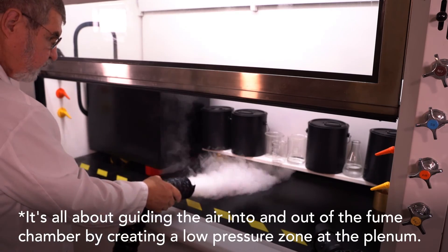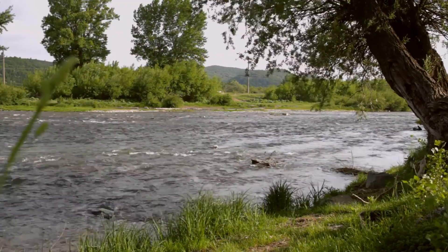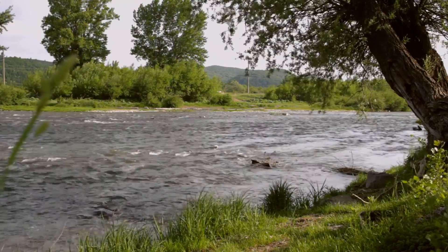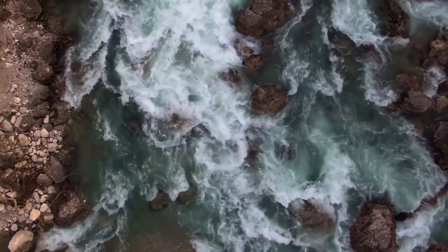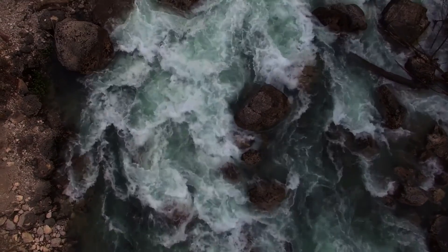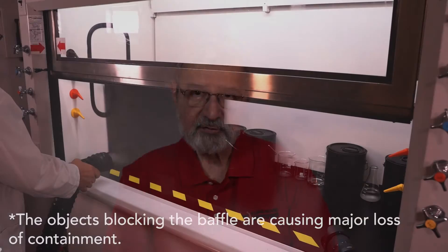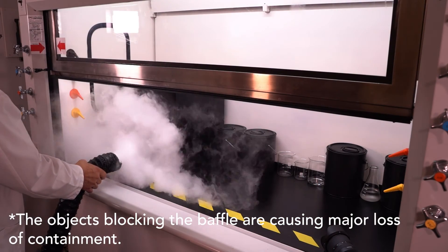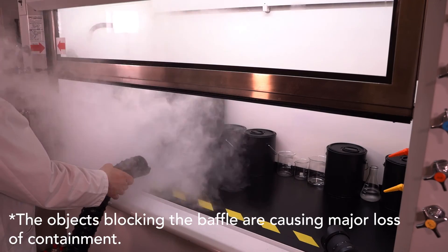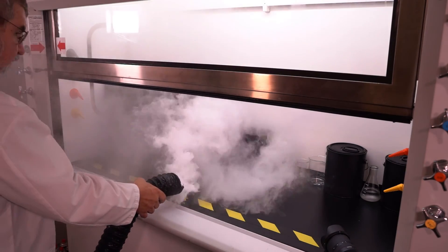The air is like water flowing down a river — smooth and calm. Now put some boulders in the river and the smooth flowing water turns into rapids. Objects in the hood do exactly the same thing to the airflow. These objects can create enough turbulence to cause the hood to lose containment, which could contaminate the lab air and create hazards for the users, the equipment, and the work.